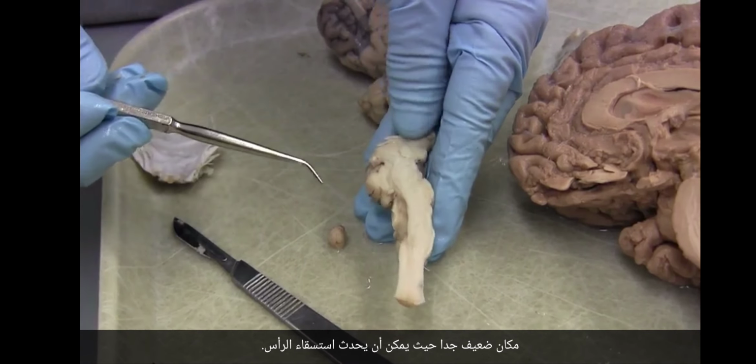And from the fourth ventricle, CSF leaks out. This is really cool. Okay, so here's the brain, and there's a leaking point right here called the foramen magendie, and then there's these two leaking points over here on either side, the two foramina of Luschka. Well, no, one foramen of Luschka, two foramina of Luschka.